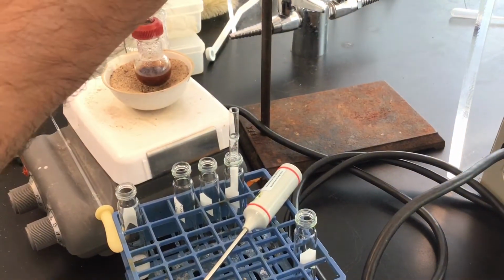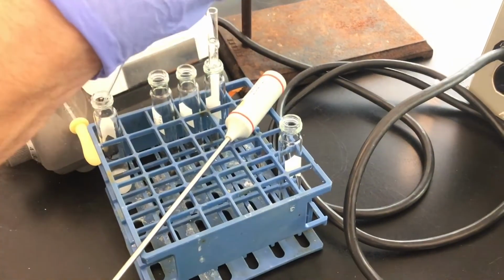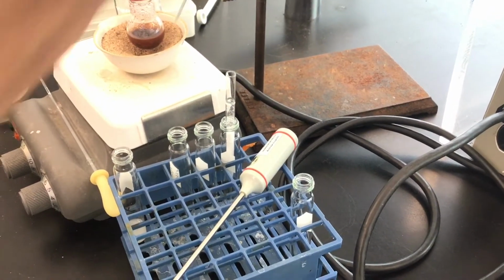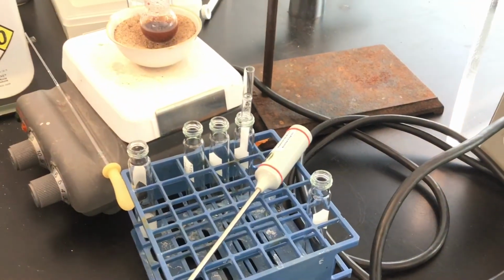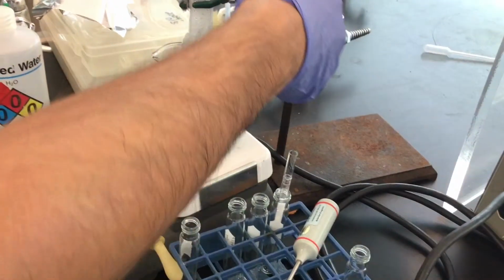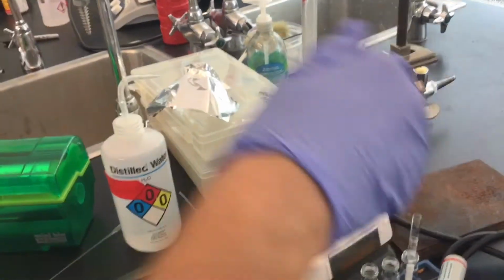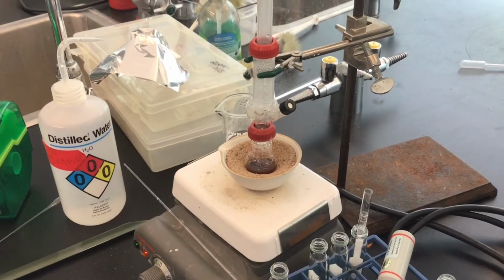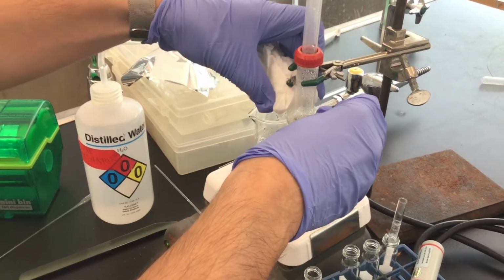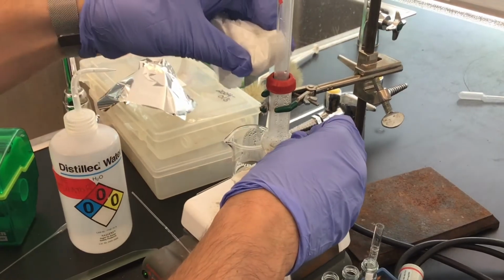All right, and we can see it's still pretty milky, so this is still going great. Once it begins to be just clear, if it's just water, then we know that we've steam distilled out as much as we possibly can. But since it's still milky, we're going to continue with the steam distillation. So now I'm going to put it back and hope that it won't bump, that issue. And also this ice in the paper towel trick seems to be working in my favor. So that's an adjustment to the experiment to take note of.